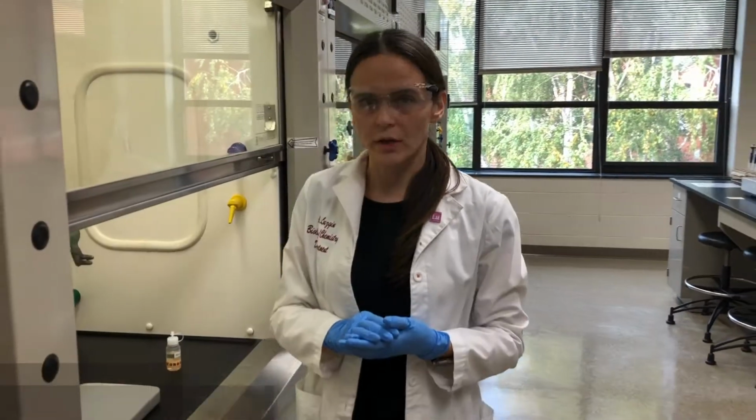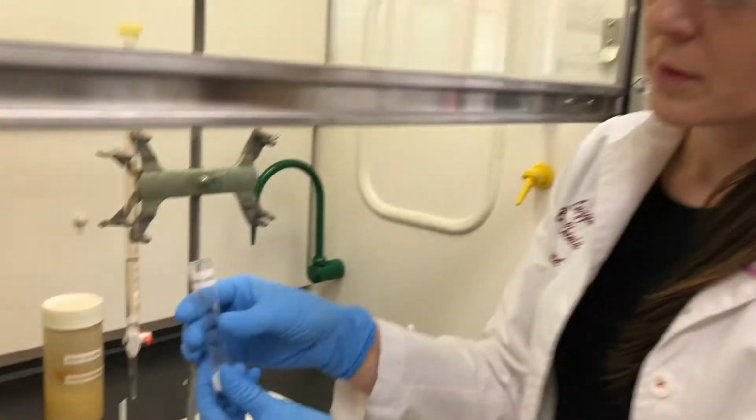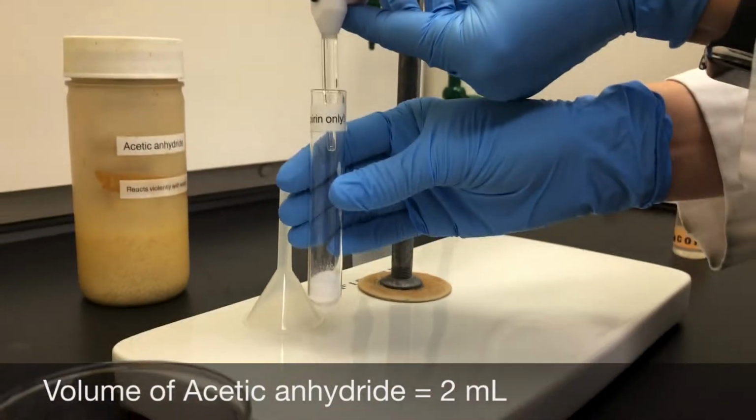So the next thing that I'm going to do is add the second main ingredient, which is acetic anhydride. Right, so my acetic anhydride is inside a burette. Here's my salicylic acid. I'm going to open up the stopcock and add about 2 mL of the acetic anhydride.